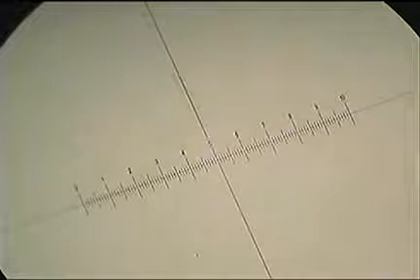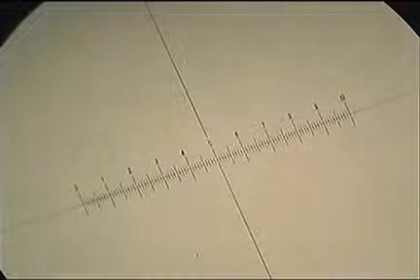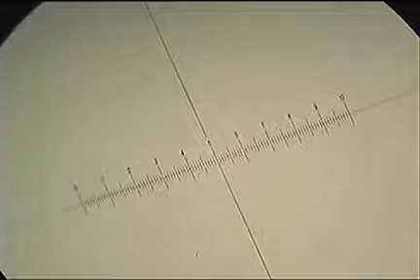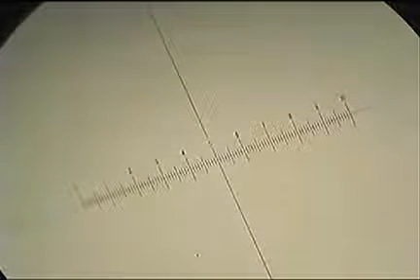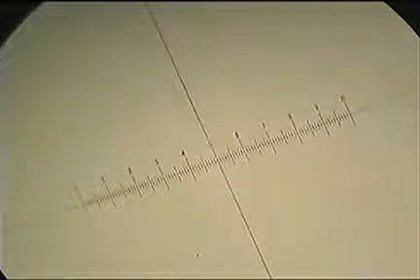Unfortunately, those units don't really mean anything. So we can use that to take measurements, but we first need to calibrate them to find out what each unit on there actually represents. You'll notice that if you flick the microscope onto medium or low power, the scale doesn't actually change, and that's precisely the issue, because we'd be taking a different measurement each time. So we need to use one of these.